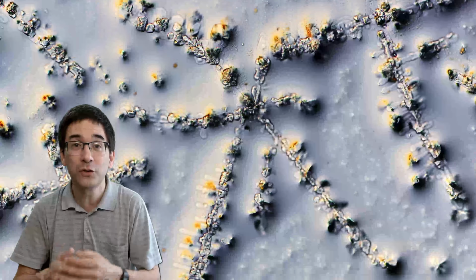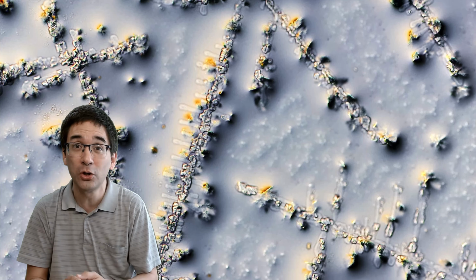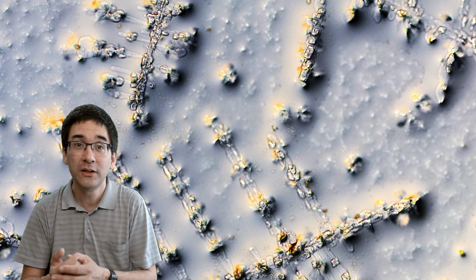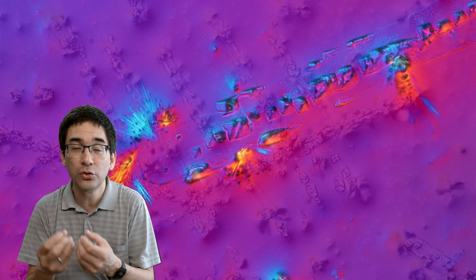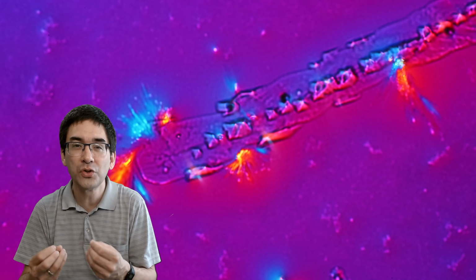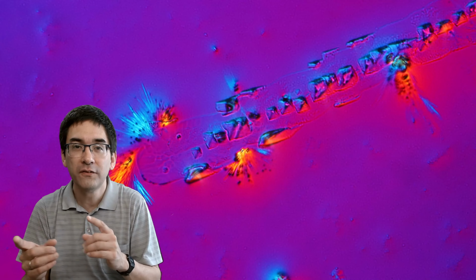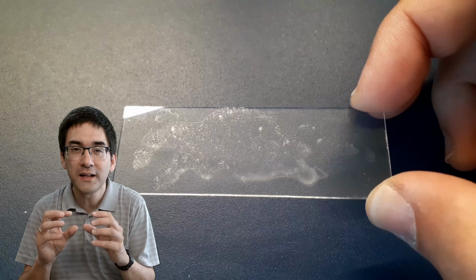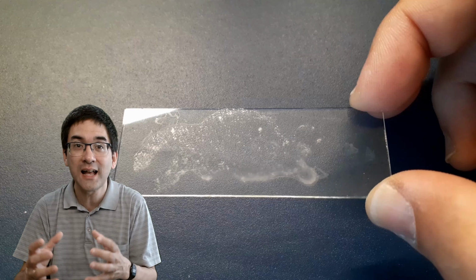Well, we're looking at crystals here because urine is quite a complex mixture of different substances. It contains salts, it contains urea, possibly phosphates, and so on. And when you allow a little bit of urine to dry on a microscope slide, those substances are going to crystallize out, and you're able to see a variety of different shapes of crystals. For example, very fine hair-like crystals and other larger hexagonal crystals.